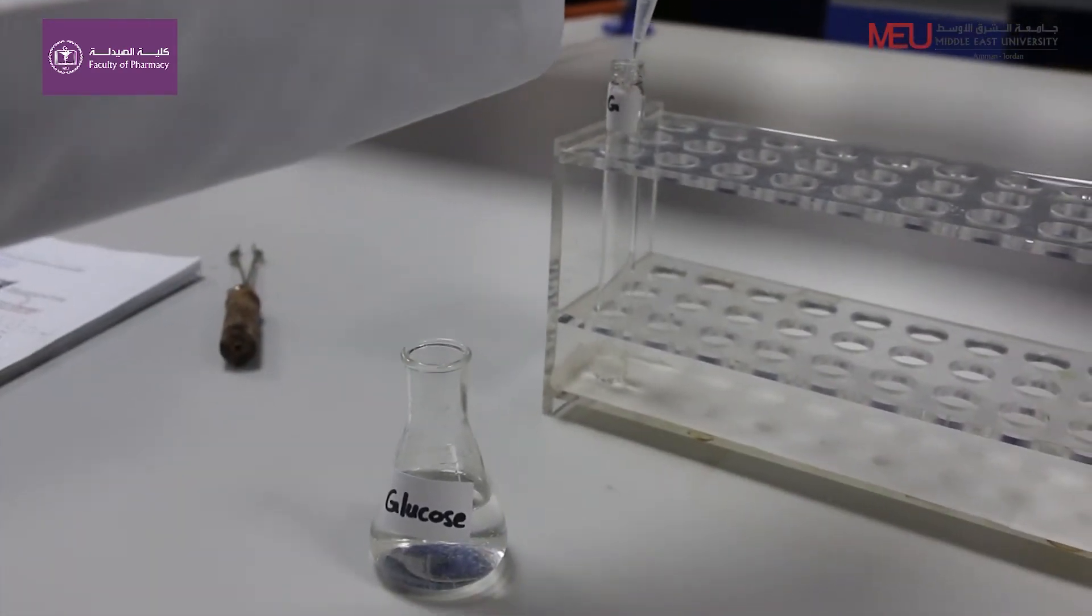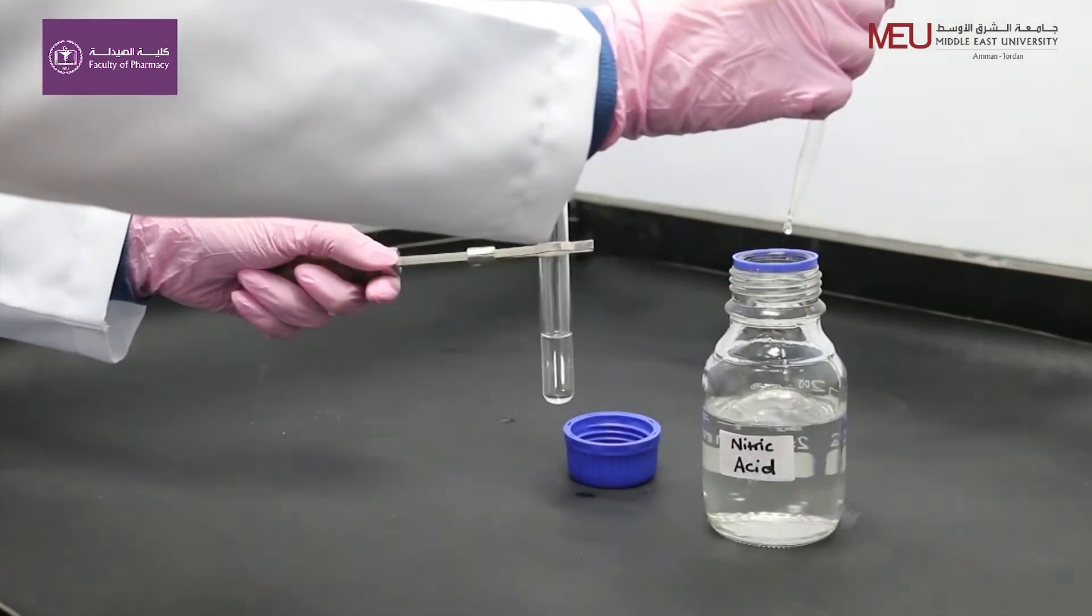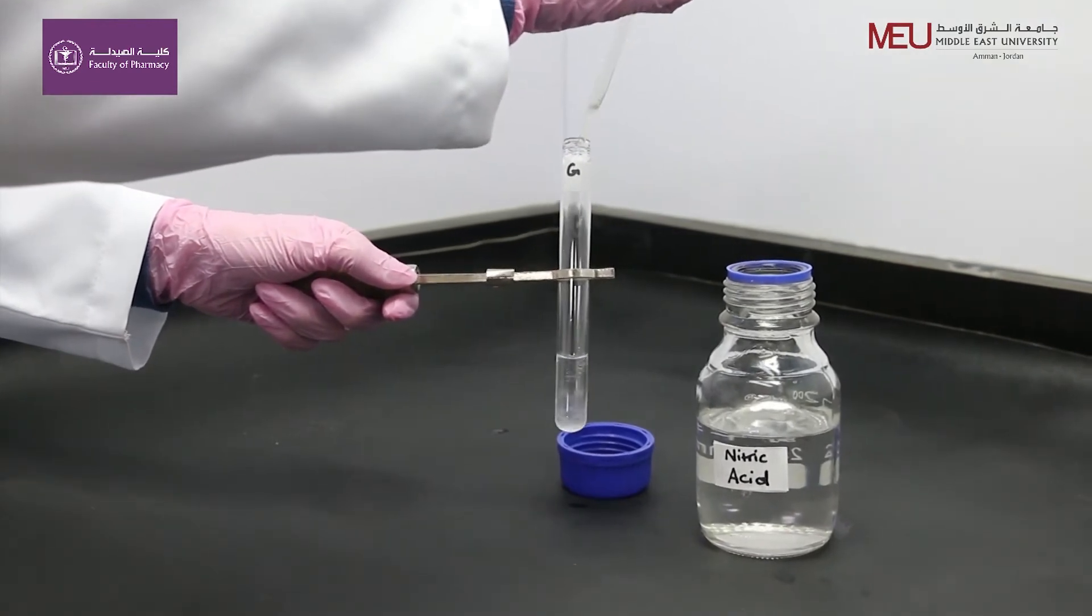Add 5 ml of test sugar solution. Add 1 ml of concentrated nitric acid.